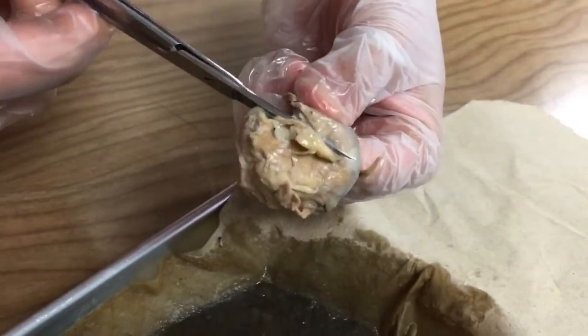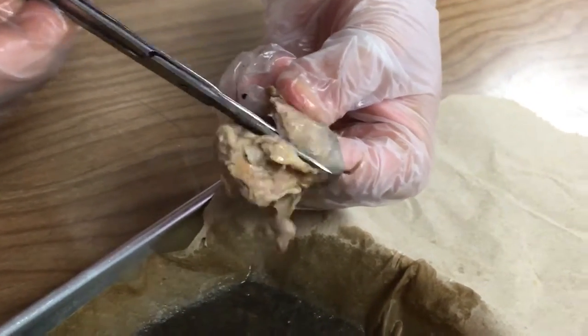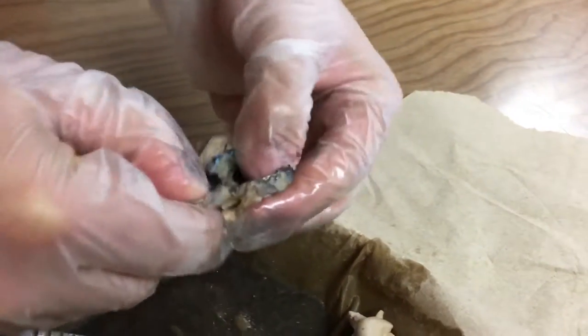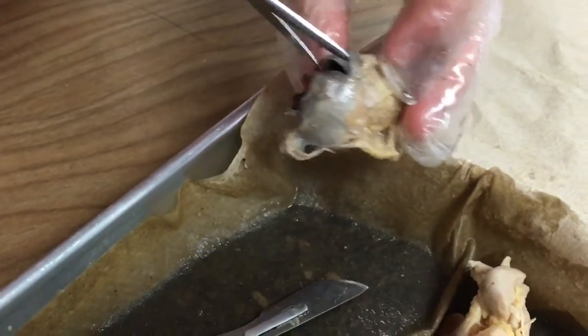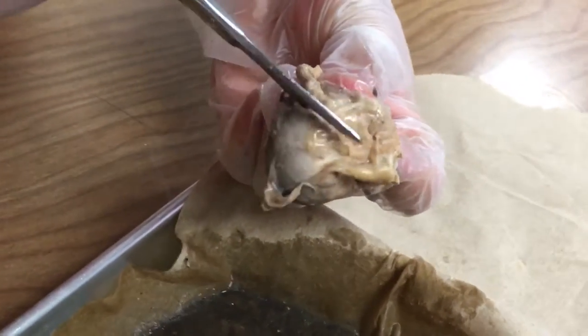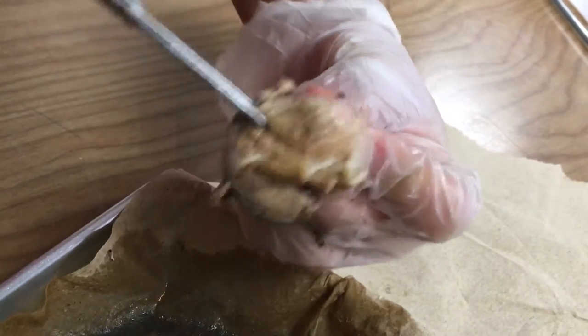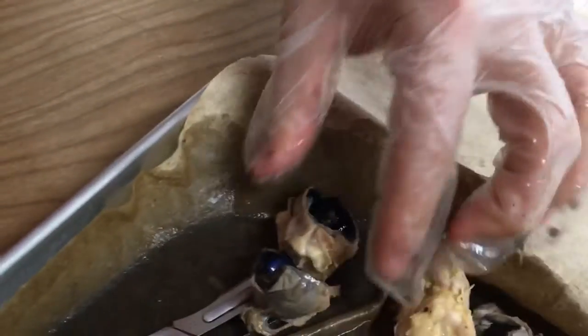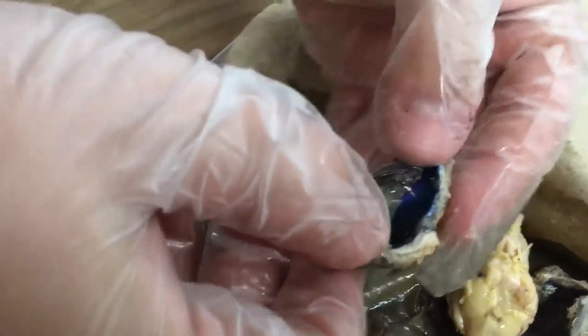And it's gonna be fine. Is that for pizza? Might as well be. Oh, it's even more blue in this one. Oh, that's awesome. Yeah, hold on. That one looks a lot different. How do you spell dissecting? D-I-S-S-E-C-T-I-N-G. Look at that. I don't know what we should see.